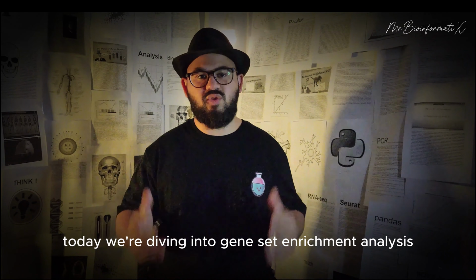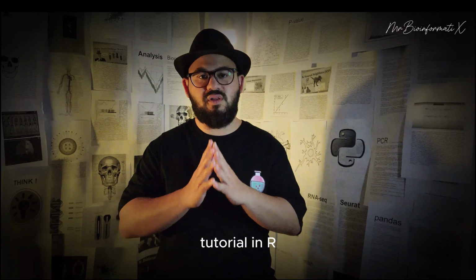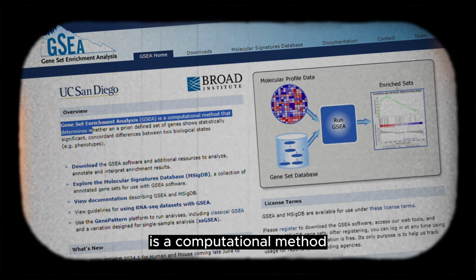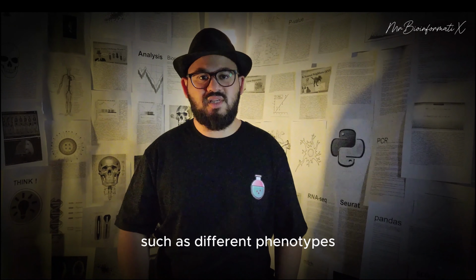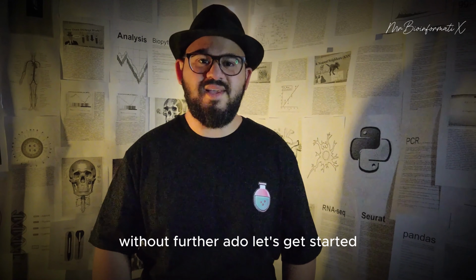Greetings everyone. Today we're diving into a Gene Set Enrichment Analysis tutorial in R. According to their website, Gene Set Enrichment Analysis is a computational method that determines whether a predefined set of genes shows statistically significant concordant differences between two biological states, such as different phenotypes. Without further ado, let's get started.